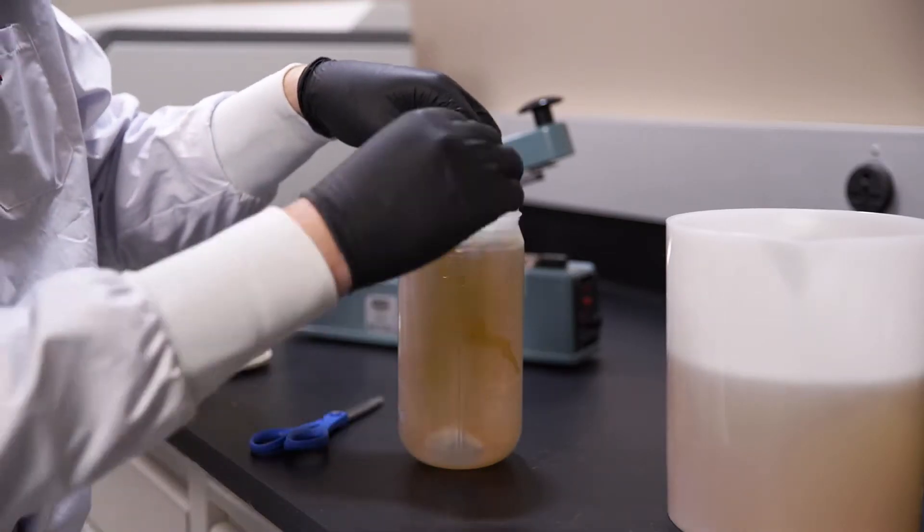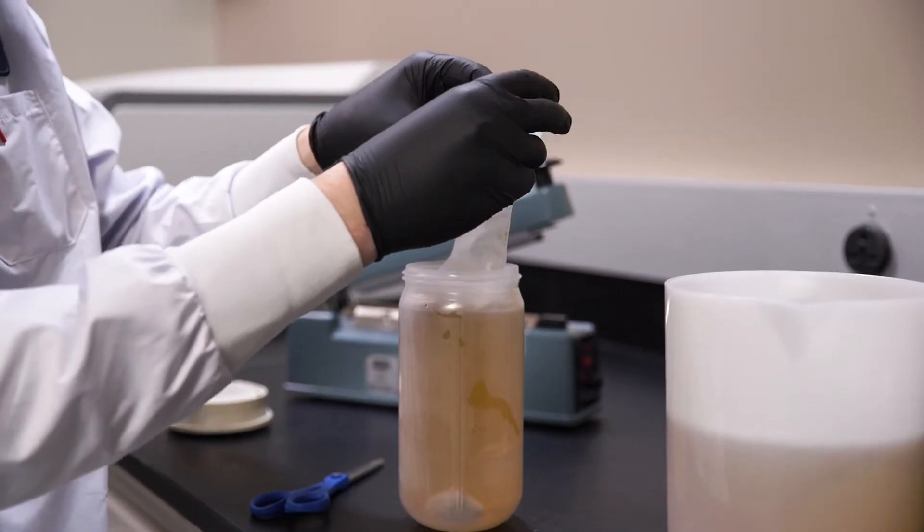To access the separated sample after centrifugation, unfold the liner out of the bottle.